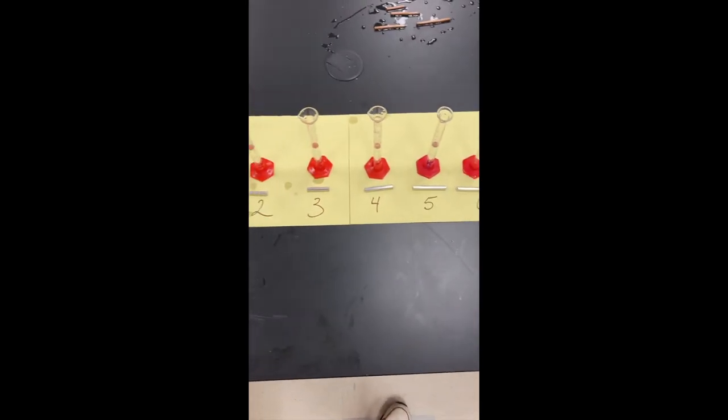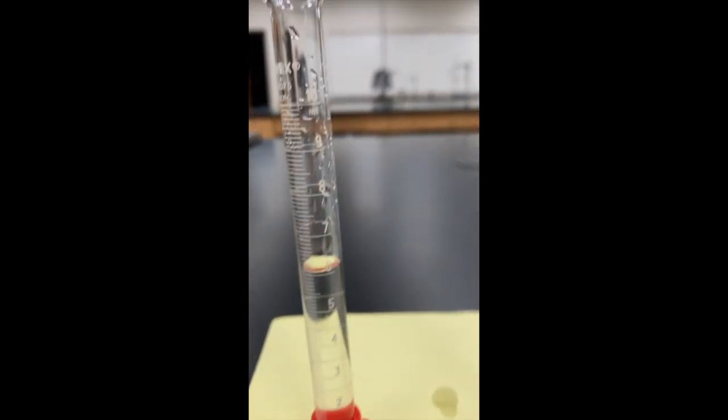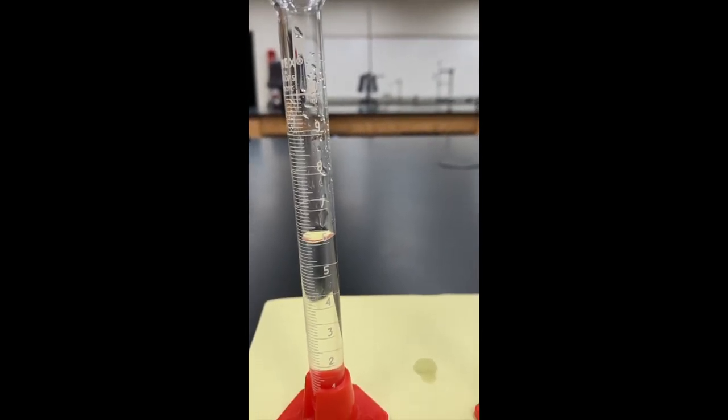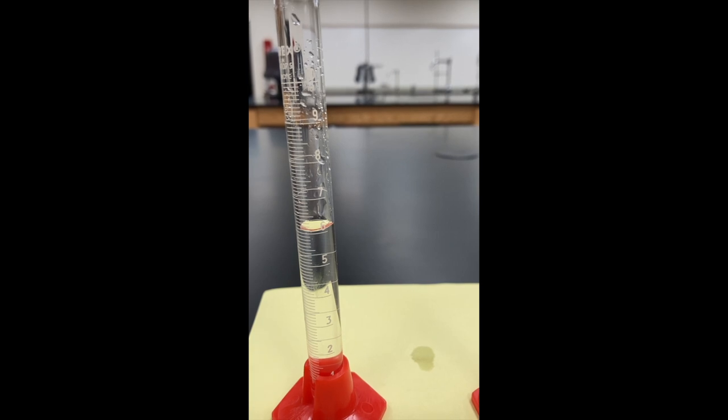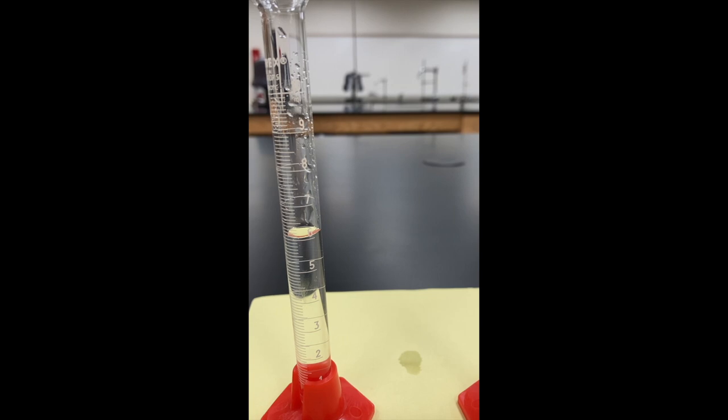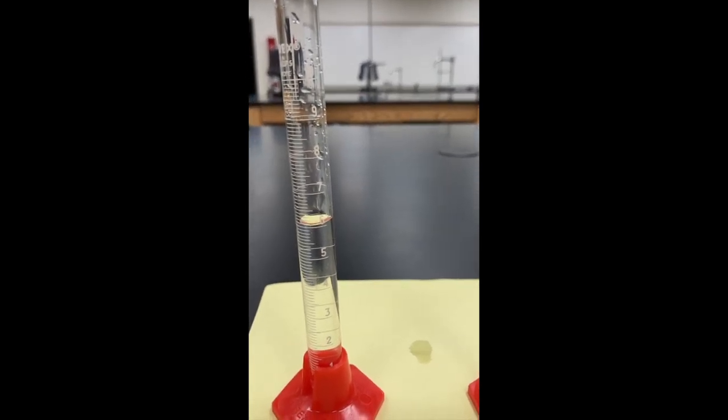I've already put some water in the graduated cylinders because we're going to use what's called a water displacement method. The metal pieces are not a nice shape that we could calculate, and so instead we're going to use an experimental technique.